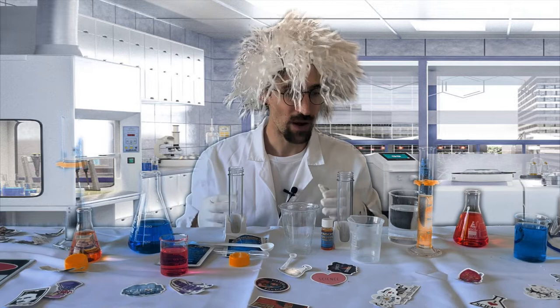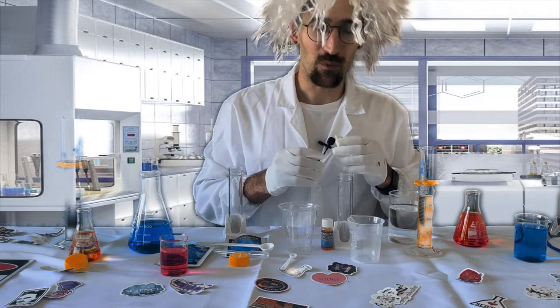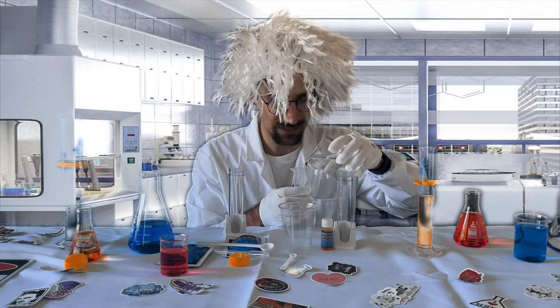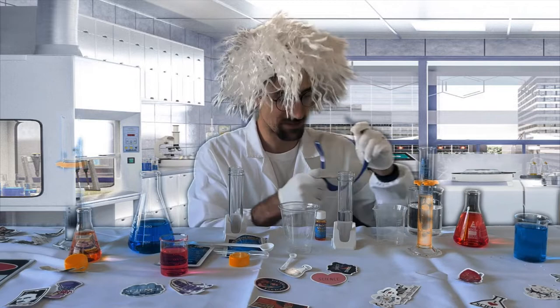I hope you have everything together in front of you. Let's go through this experiment to take a look at what's going to happen after we create a basic solution with an indicator, an acidic solution, and then ultimately mix the two together. So step one, we're going to be taking 20 milliliters of water and pushing it into the test tube. I'm also going to make sure to put on my safety equipment — glasses — and I already have my gloves on.